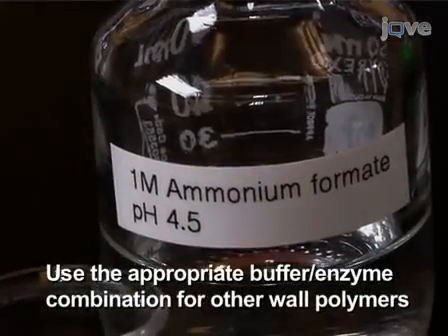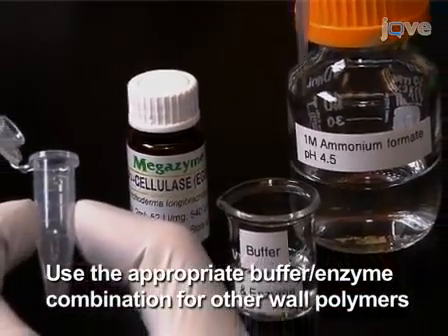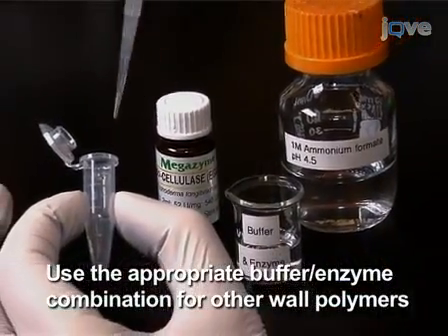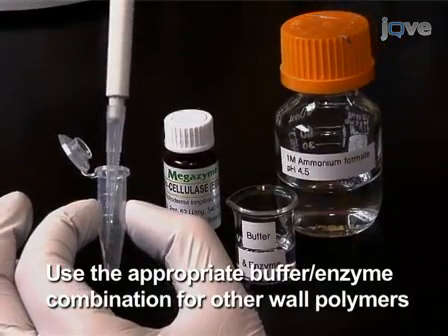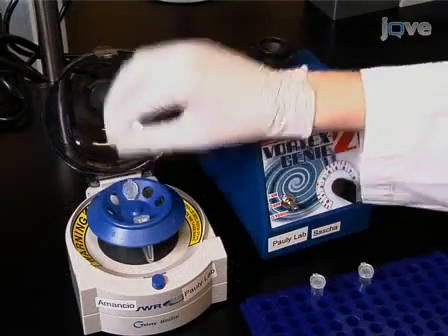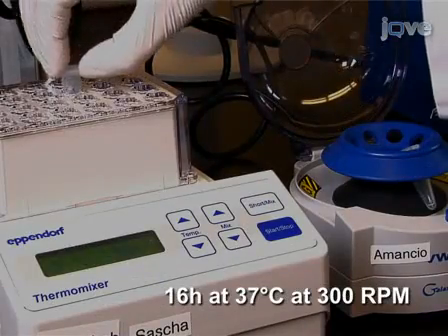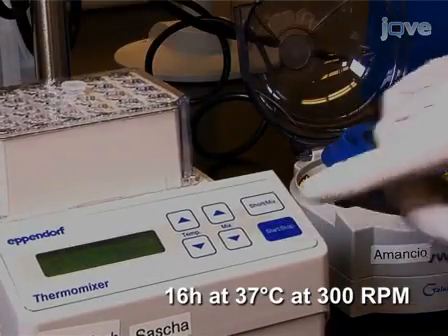To solubilize this hemicellulose, resuspend the dry isolated cell wall pellet in 25 microliters of 50 millimolar ammonium formate, pH 4.5, and add 0.2 units of endoglucanase. Vortex the suspension and spin the liquid down. Place the tube in a mixer and let the walls digest for 16 hours at 37 degrees Celsius with shaking at 300 rpm.